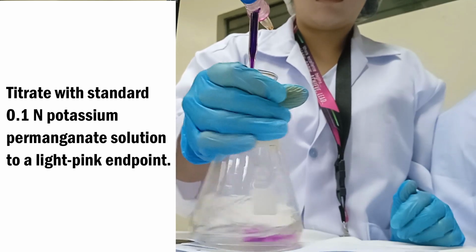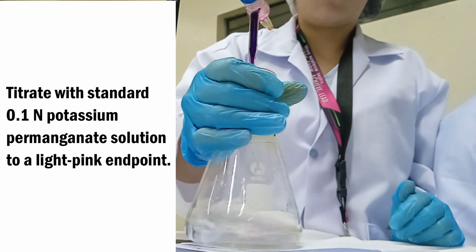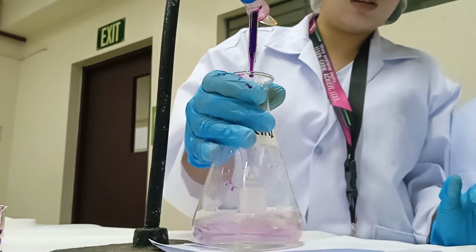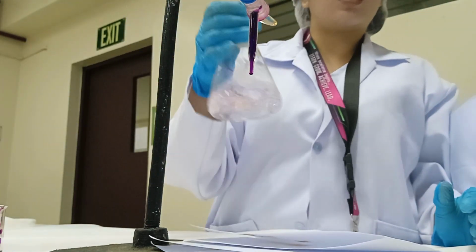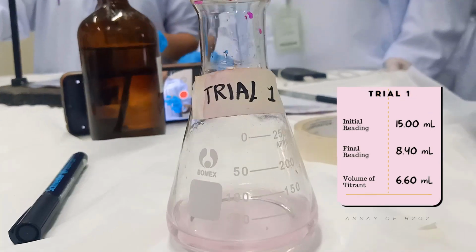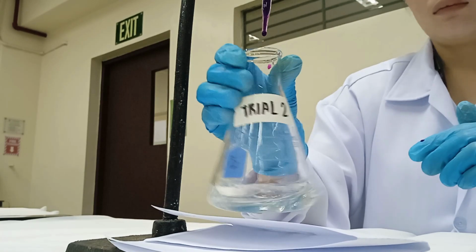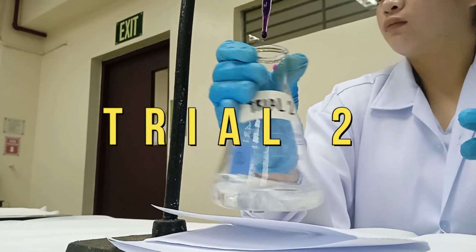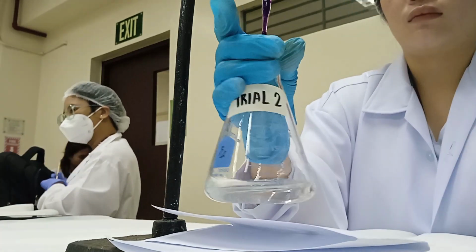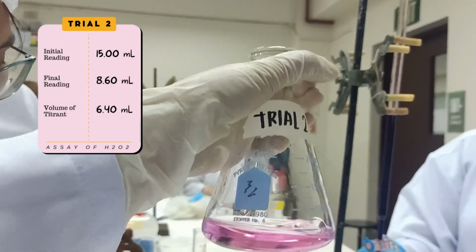Titrate the analyte using the standardized potassium permanganate solution until a permanent light pink endpoint is achieved. Record the volume of titrant consumed. Repeat the process twice for a total of 3 trials. Again, record the volume of titrant consumed for each trial.